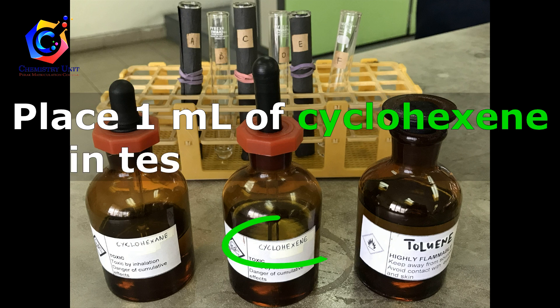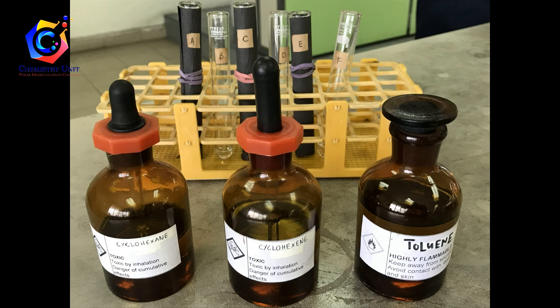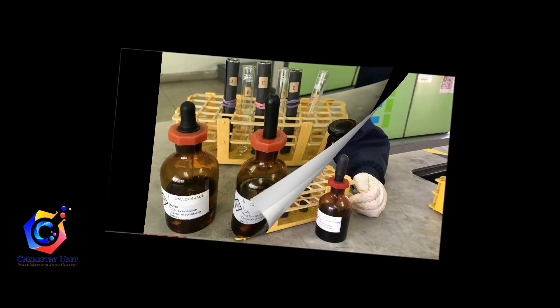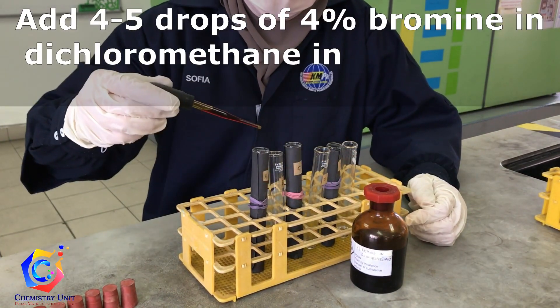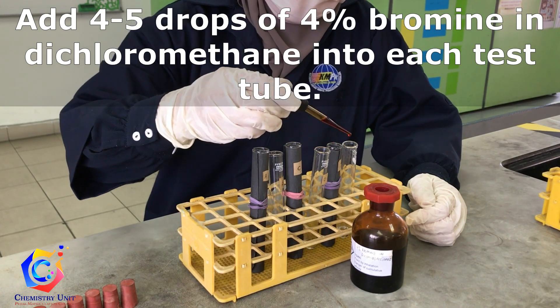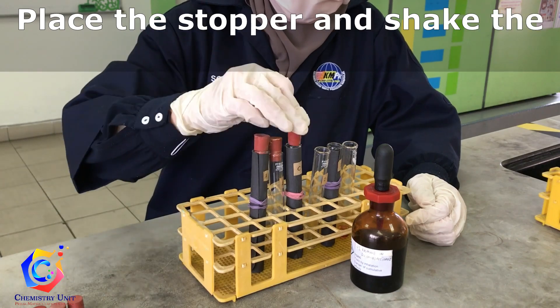Place 1 ml of cyclohexene in test tubes C and D. Place 1 ml of toluene in test tubes E and F. Add 4 to 5 drops of 4% bromine in dichloromethane into each test tube. Place the stopper and shake the test tubes.